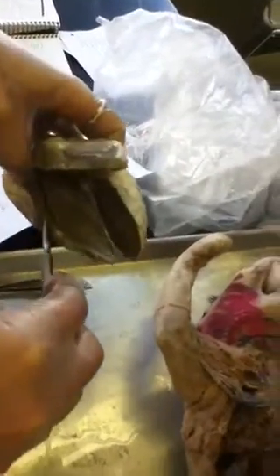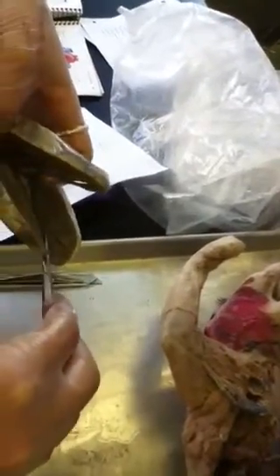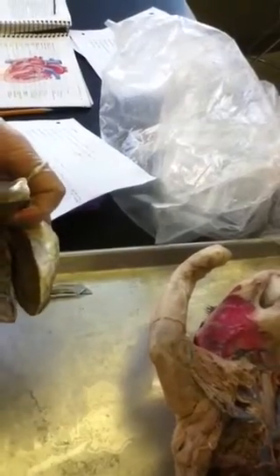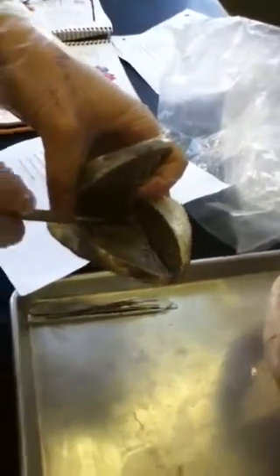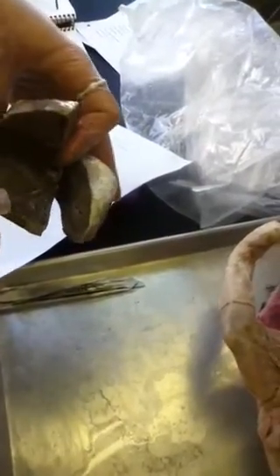We can see that the right ventricle wall is really narrow versus the left ventricle, which is really thick. Again, this muscle in between is the papillary muscle, which is basically holding all the chordae tendineae, which are those white strings that are basically opening and closing the valves. They're either the bicuspid, which is located on the left ventricle, or the tricuspid, which is located on the right ventricle.